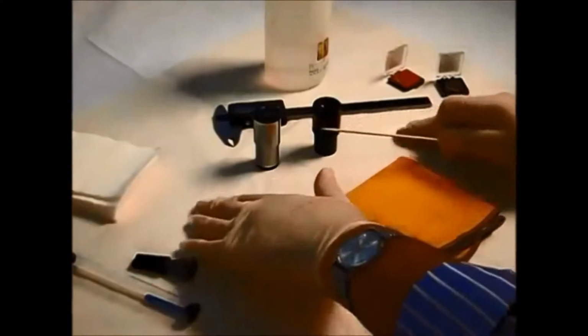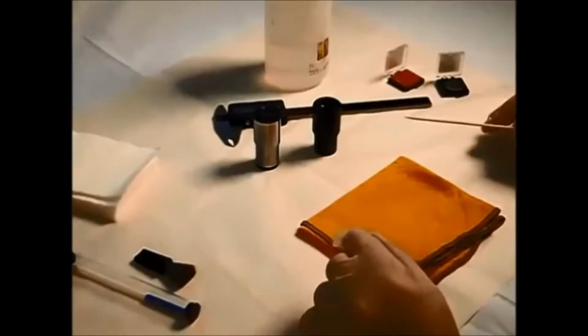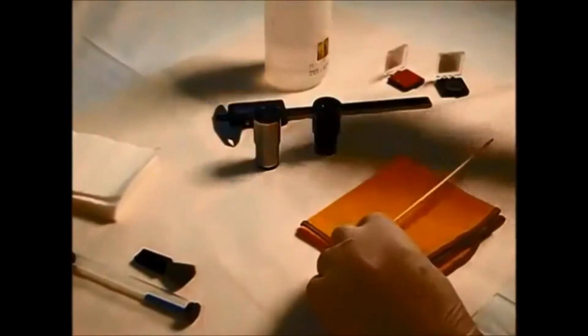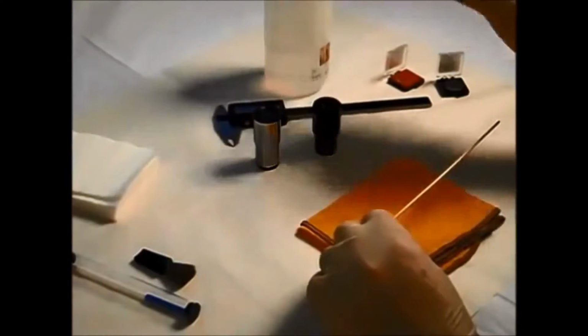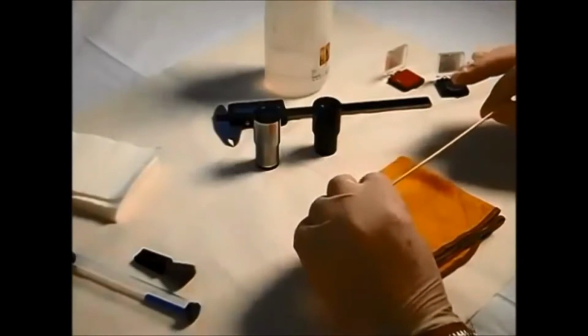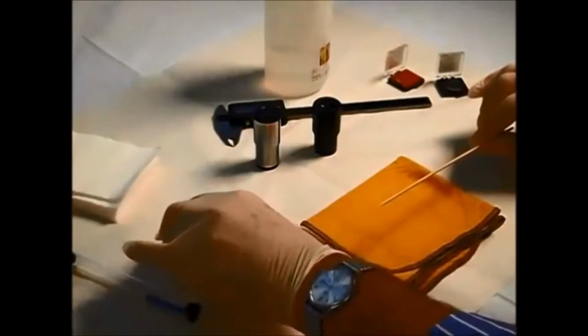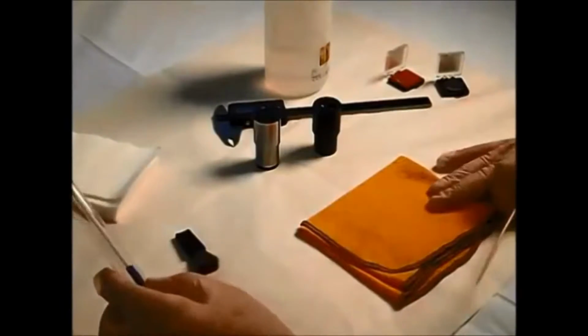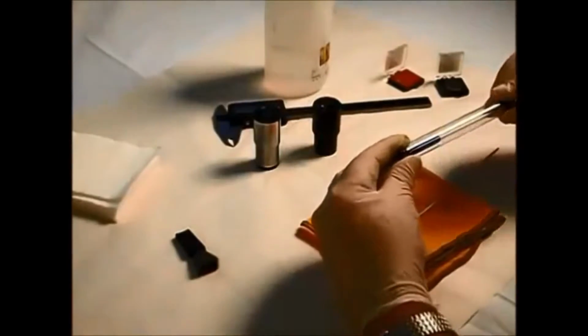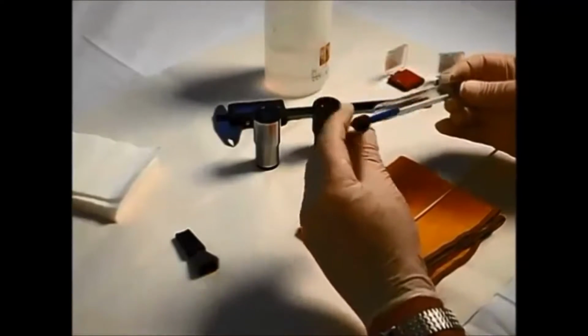First, ensure that your working area is clean and dry and that you have the necessary bits and pieces and tools around you. It's essential to ensure that you've got some cleaning optical fluid, some lint-free tissues. Optical cleaning kits are readily available which have all of these in it, and they may come along with some additional items and tools such as brushes or anti-static cloths like this one, or speck grabbers, which allow you to take individual specks of dirt or dust from particular glass.